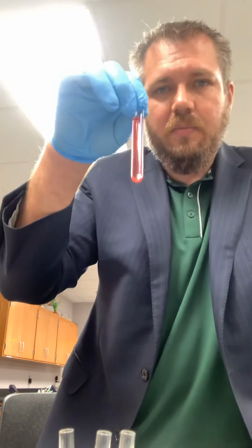In part 3, we're going to test and see how well you did with those dilutions. Again, if you started off with the right amount of food dye, and then you diluted it properly without getting too many drops where they're not supposed to be, and using the right volumes with your graduated pipette, we should be able to see that, and we're going to use an instrument to read and see how well you did. So that'll be part 3. I'll be back over here telling you about the spectrophotometer.